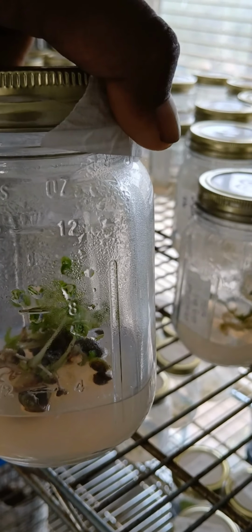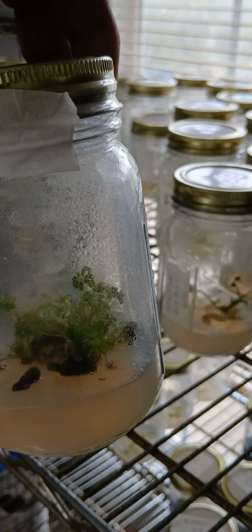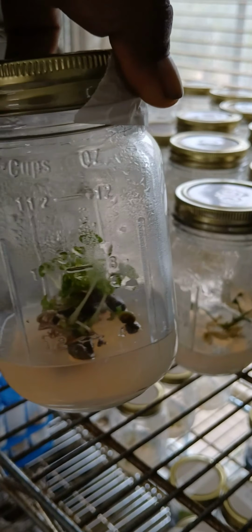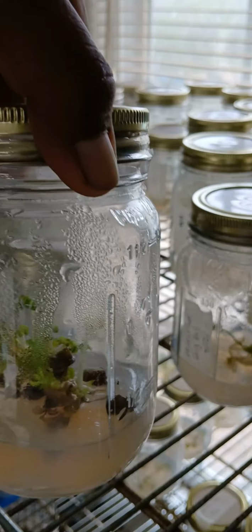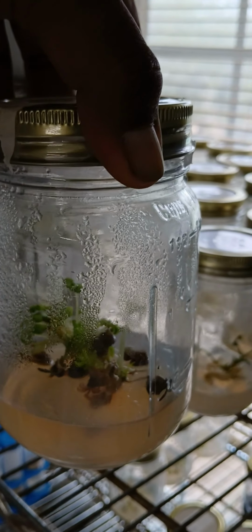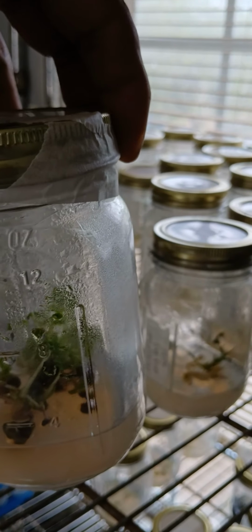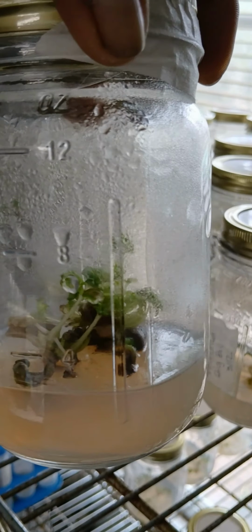Here's an update on the lupine seeds that we moved into multiplication from a single seed subculture that we did 2 weeks ago. Look at this. This is where we subcultured that mass into multiple little chunks and put them in. I think we put 3 or 4 little clusters into each jar, and look how this thing is growing. We've got a couple of dozen plantlets growing in this jar alone.